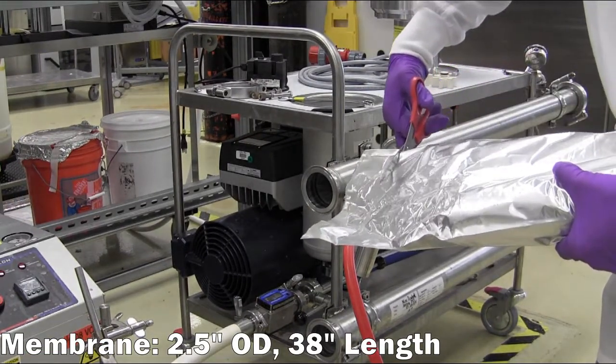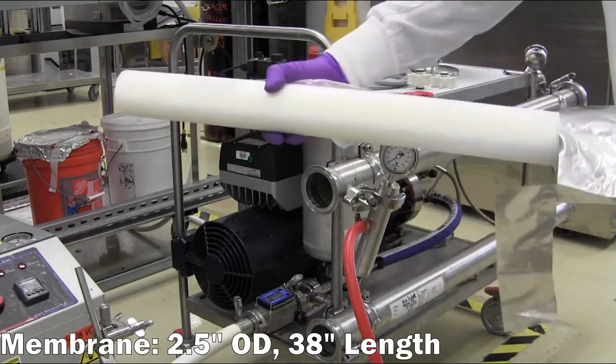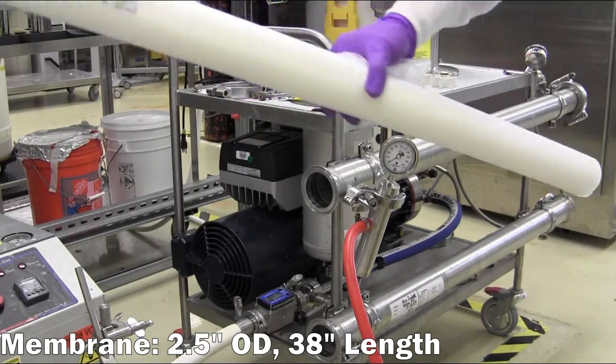The M20 is compatible with membranes with a 2.5 inch outer diameter and a length of 38 inches, often referred to as a 25-38 membrane.